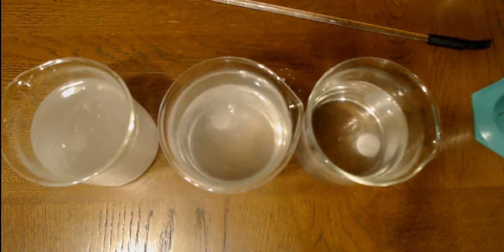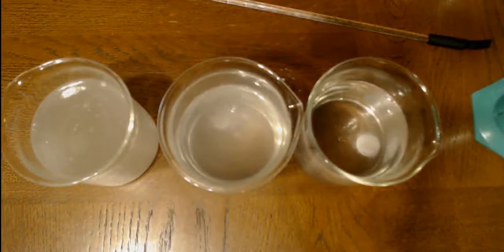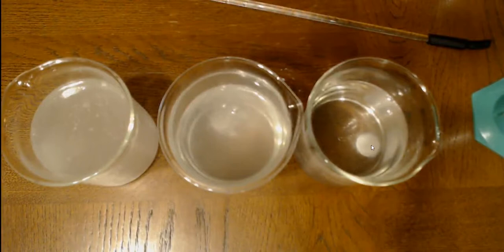We'll see. So what's interesting is our vinegar is actually already diluted. Vinegar itself, 100% vinegar, is a rather strong acid. What we put on our salads and eat is 5% vinegar. So that means the vinegar I put in there originally was 5% vinegar, 95% water. So this one is 5%. That means this one's only 2.5%. And this one is 1.25% vinegar. And the water won't react with the antacid, only the vinegar.